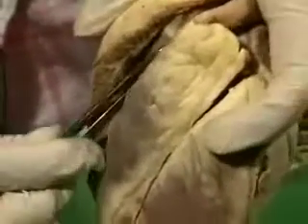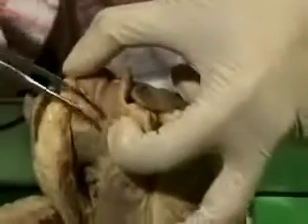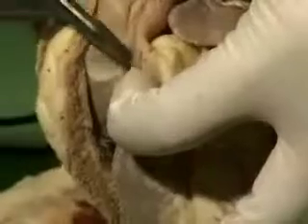And once it's entered here, it now passes out through the pulmonary orifice, which is this one. So you can see that the pulmonary orifice is more anteriorly placed. And this pulmonary orifice is also guarded by valves, but these are not cusps like those. These are semilunar cusps. And if you can zoom in, you can see this really good. See, these are the semilunar cusps. And see, this is the sinus, this little space up here. It's like a little cul-de-sac. This is the sinus. So these are semilunar cusps. So you shouldn't make a mistake between semilunar cusps and the other cusps which are present in the atrioventricular orifices.